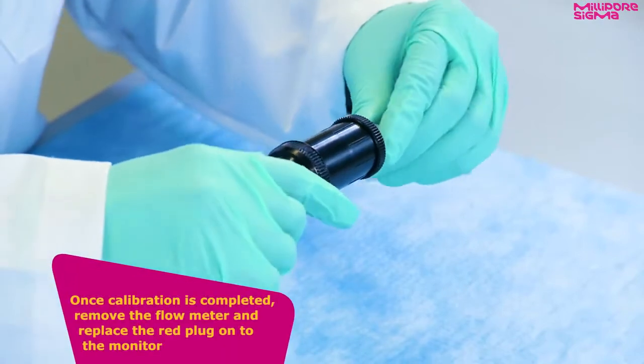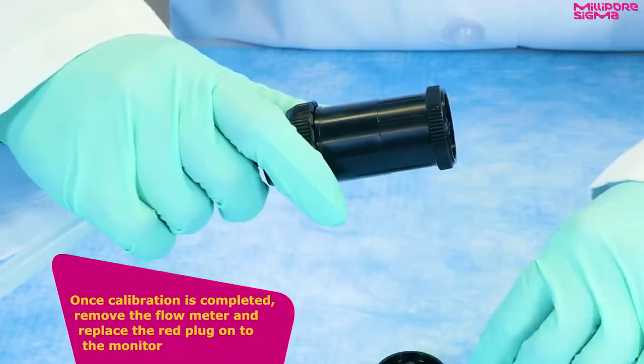Once calibration is completed, remove the flow meter and replace the red plug onto the monitor.